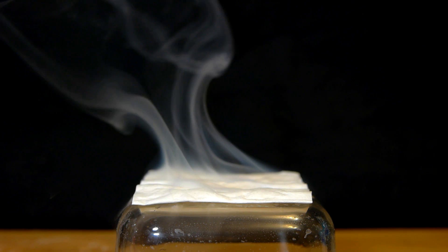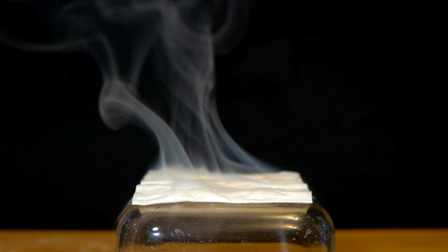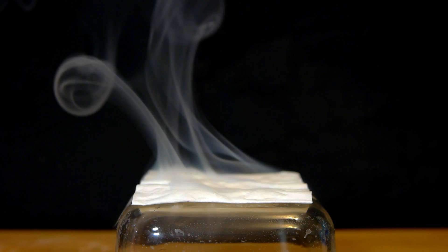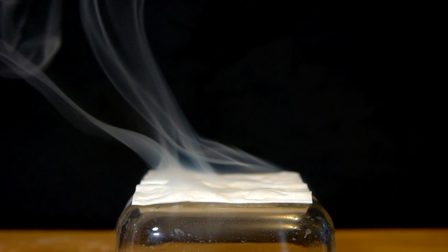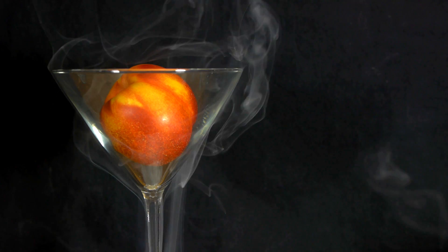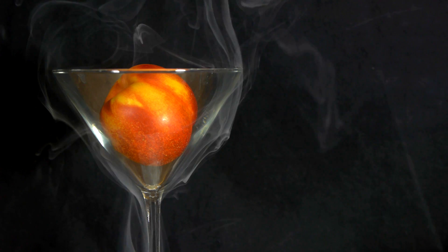This video will show how a simple reaction between two common chemicals can be used to create synthetic and quite harmless smoke. The most common use for this sort of thing is in creative photography and video special effects, but it can also simply be an interesting reaction to watch.